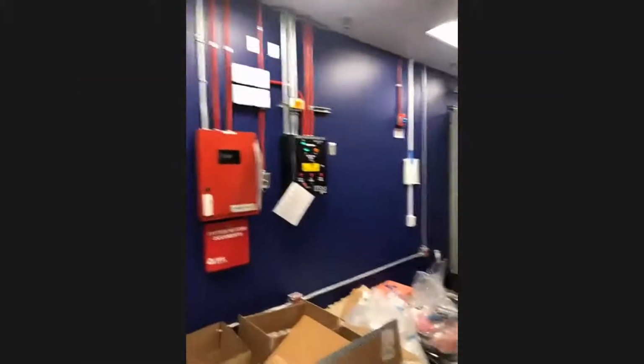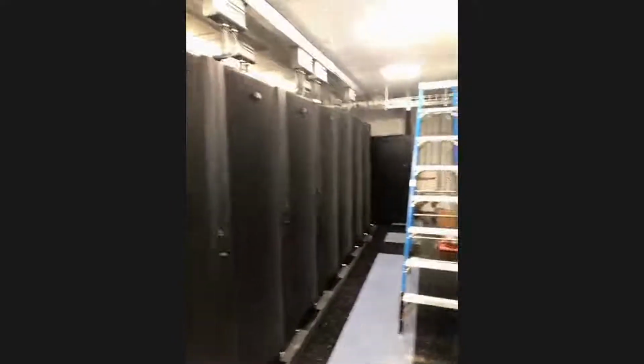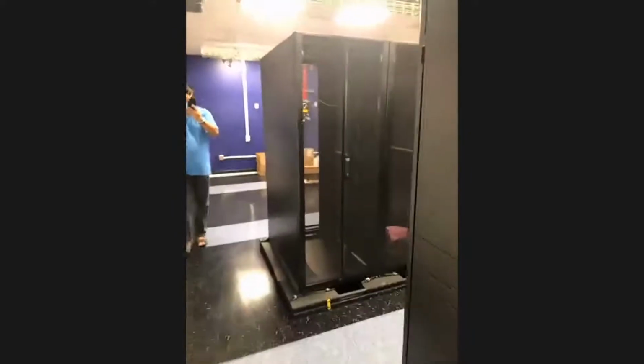And so I know it's a bit loud in here. And I don't know how much time we've got, but basically Peng is here looking at our new data center, which we have just commissioned in the last few weeks, because we need new infrastructure to be able to handle all the types of data that are coming out of these microscopes. So we have a very nice dedicated environment filled with high density storage and computing nodes, both traditional computing nodes as well as GPUs for different types of applications.